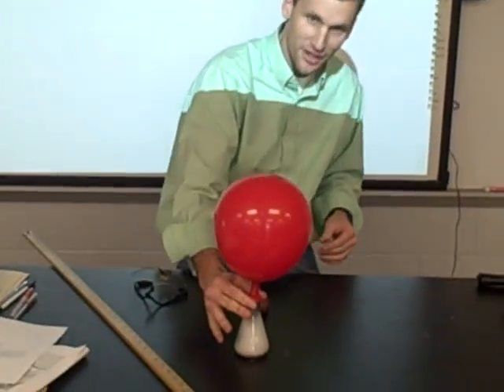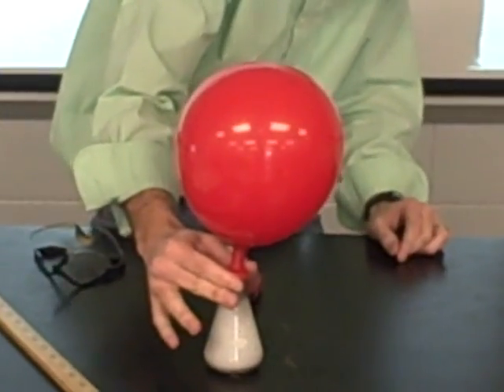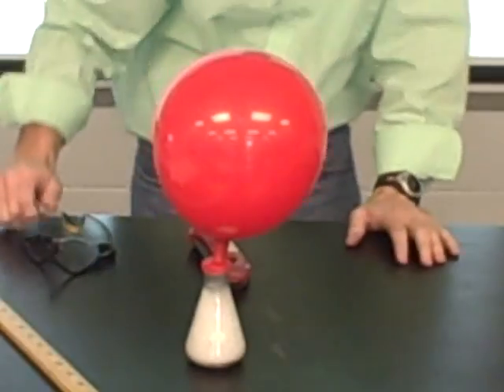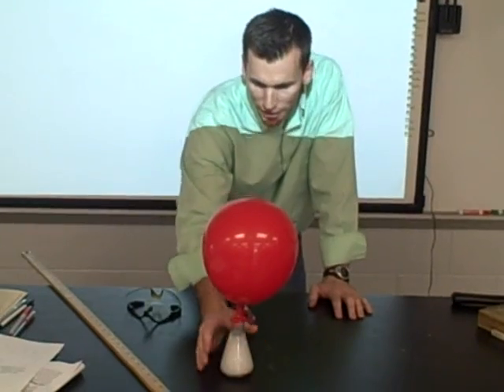If you take a look real quick, the balloon is blowing up. It's still reacting, highly vigorous reaction, highly exothermic, really hot reaction.